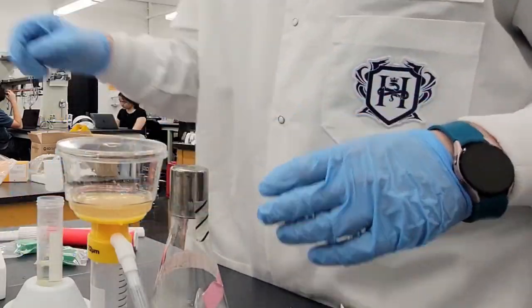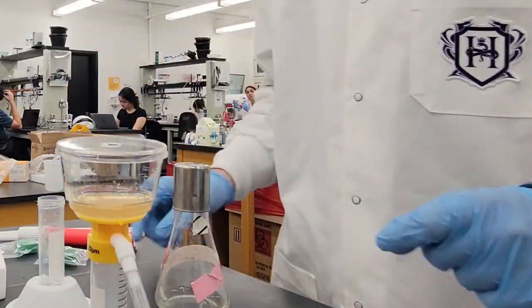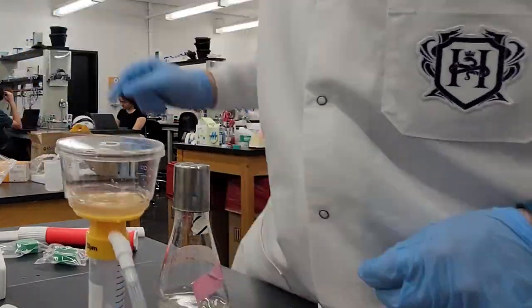On the last one, you're going to find something called a webbed plate, which is basically a plate where the phage has killed all of the bacteria, or at least most of the bacteria, on the plate. And you're going to flood it with phage buffer. This stuff is going to make the perfect environment for the phage to grow even more and have a nice concentrated sample. We're going to remove this after two hours are up and filter it to make sure that there's not any dead bacteria parts in it, but just phage.